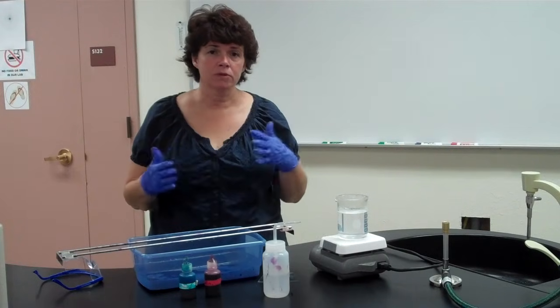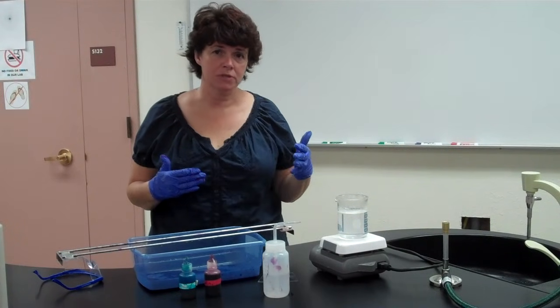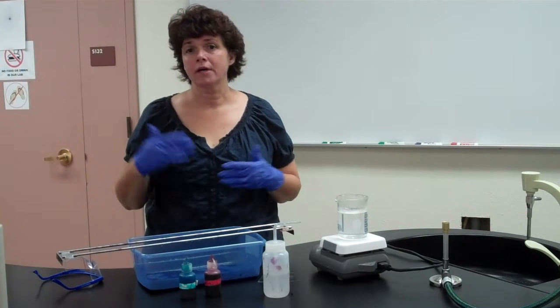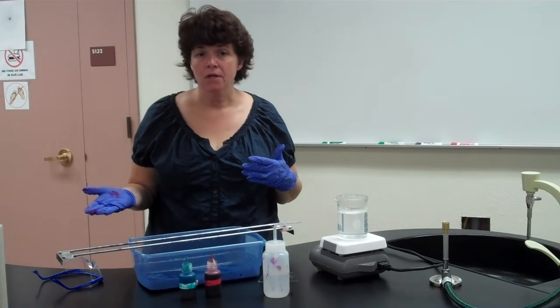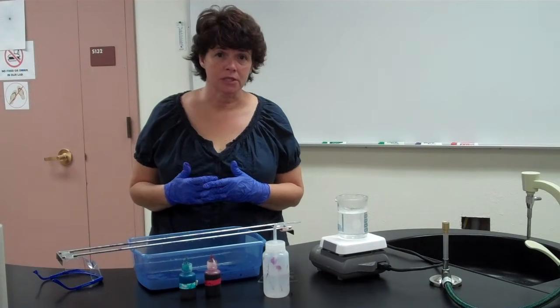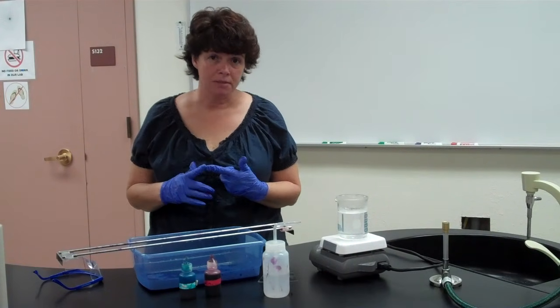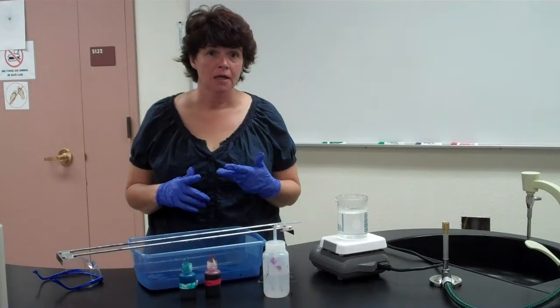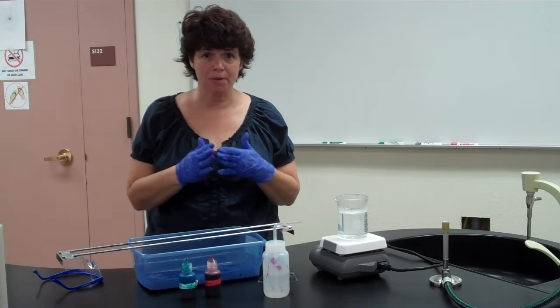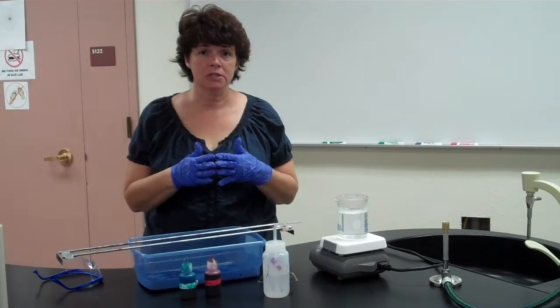The genera of bacteria that produce endospores are usually going to fall into the Bacillus genus or the Clostridium genus. Ones that are pathogenic, we find in that Clostridium genus. If you've ever heard of botulism, tetanus, gangrene, those diseases are caused by bacteria in the genus Clostridium.